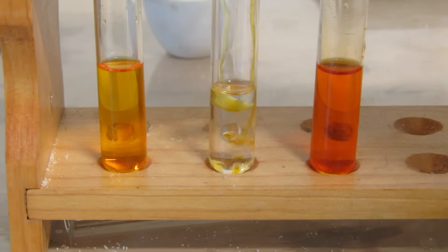Hello, and welcome to Goofer King Science. Today, we are going to be identifying alkenes using bromine water.